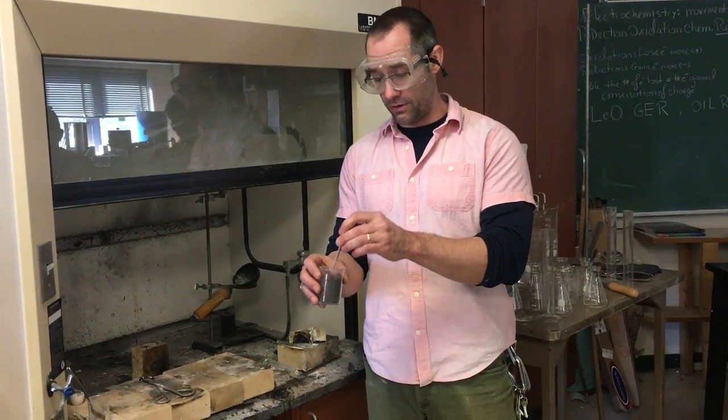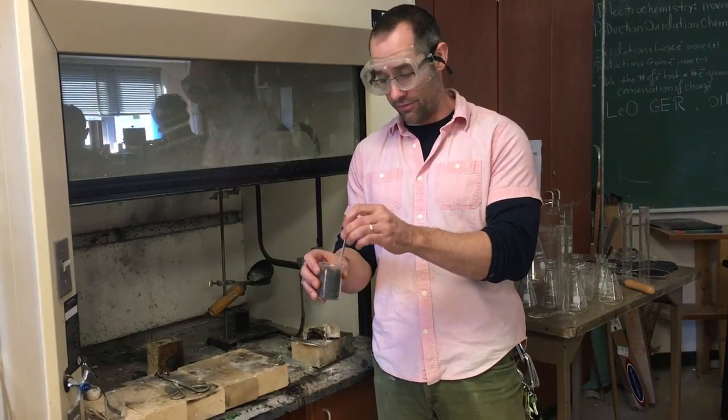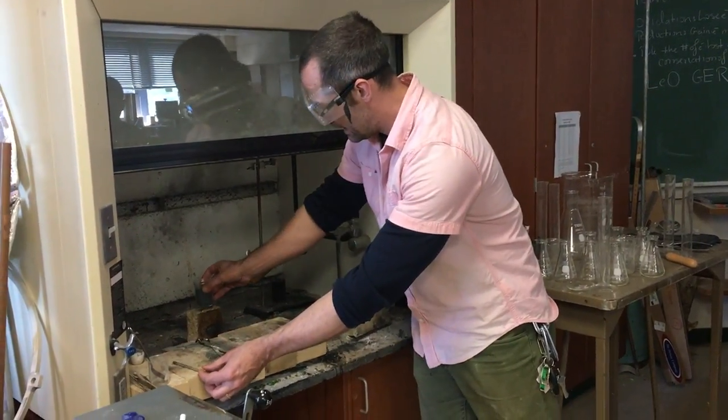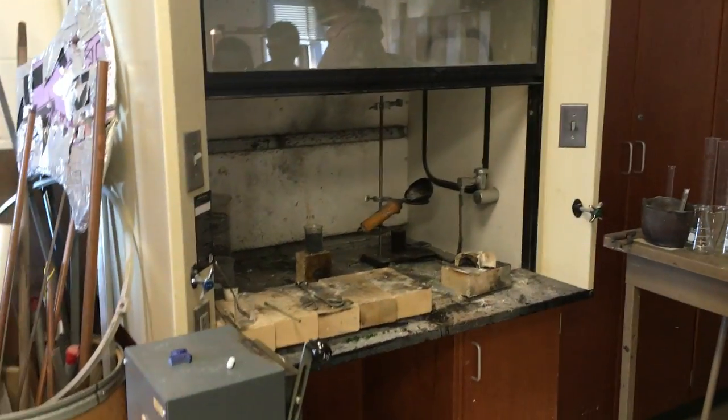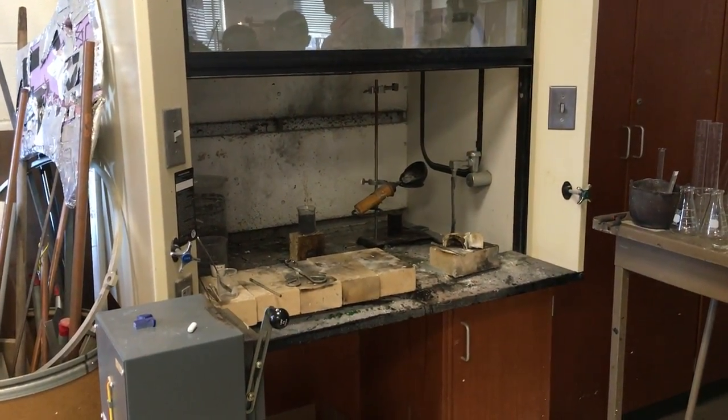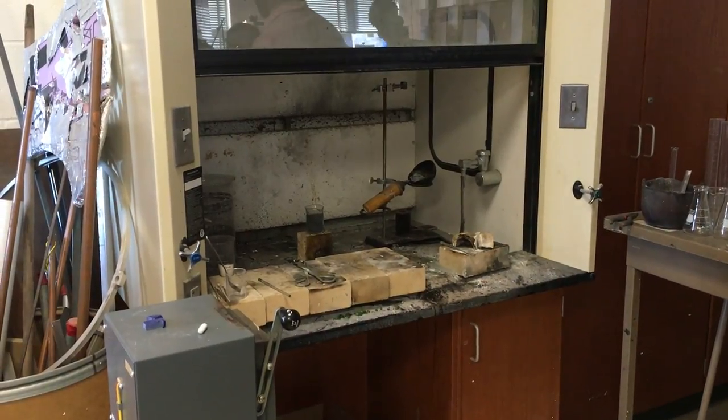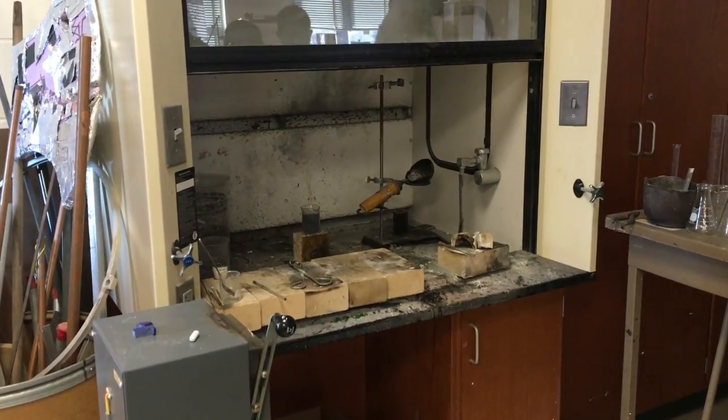Now I've got to be very careful because this reaction doesn't have, if I remember, quite a high activation energy, meaning just a little bit of energy will get this going. So to get this reaction to go, I'm going to have to provide it with a little bit of a spark, a little bit of a push.